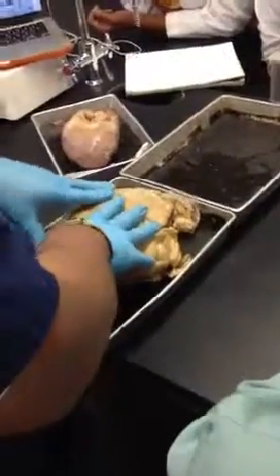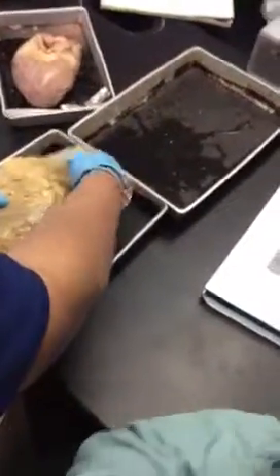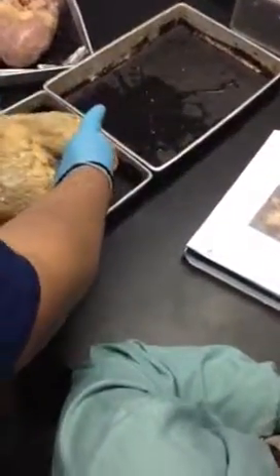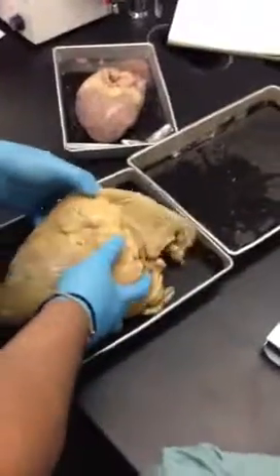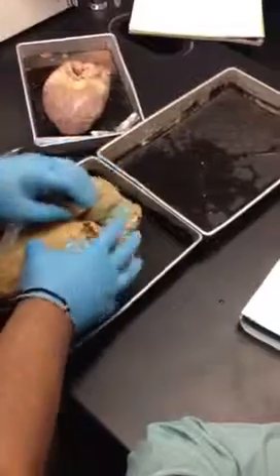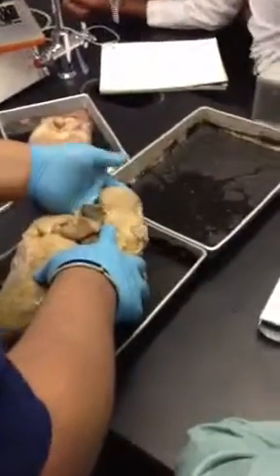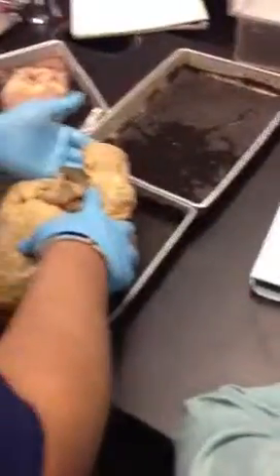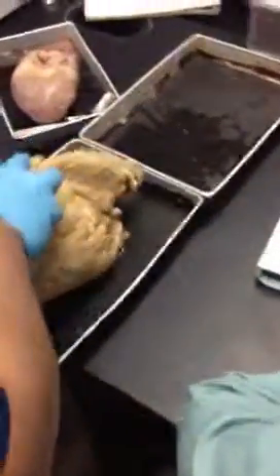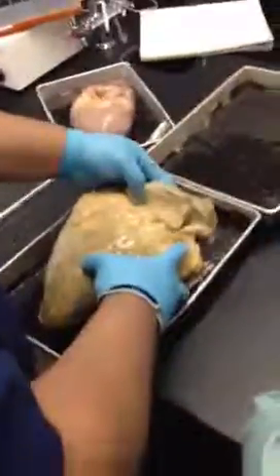Again, one of the things you have to do is figure out the front from the back and which one is which. So one of the things that you look for, for instance, is this large structure right here, which is the pulmonary trunk. Typically, the pulmonary trunk is always visible on the front. If we flip it over, you'll see that the pulmonary trunk kind of disappears behind all this other stuff, and you can still see the aorta. So the aorta is visible on both sides, both the front and the back. So we know that this must be the aorta. So we flip it back over here, we know that this is the front. Okay? So here we have the pulmonary trunk, and here's the aorta.